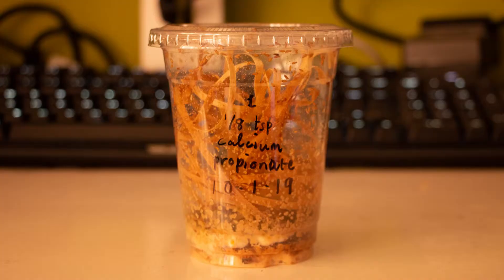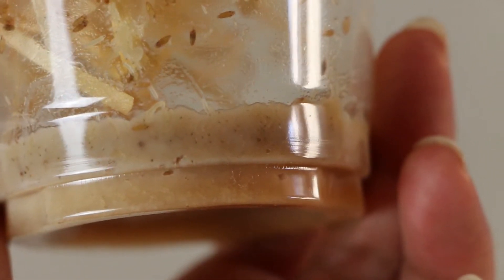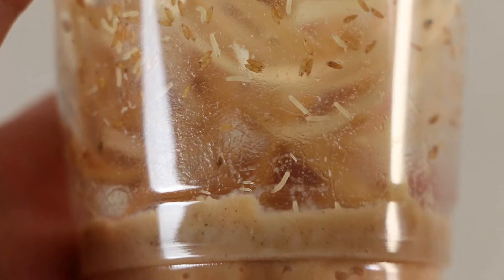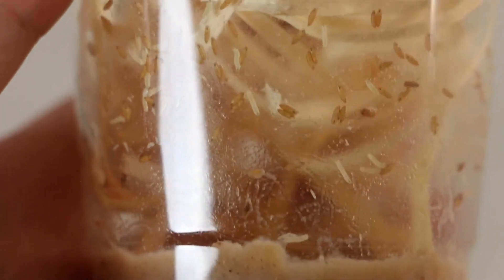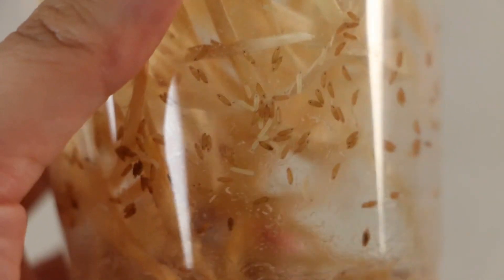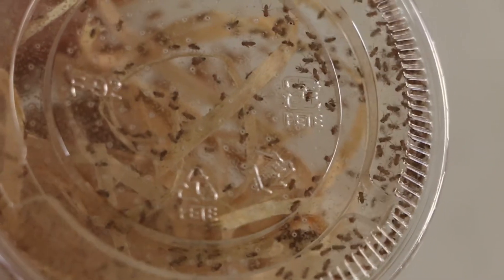High temperatures can harm the flies and larvae and in some rare occurrences, revert future generations back to their winged flying forms. Over the course of about two weeks, you will notice changes in your culture. During the first week, adults lay hundreds of eggs that are invisible to the naked eye. In a few days, tiny larvae will hatch out and live in the media at the bottom — they will eat and grow rapidly. By the end of the week, you will be able to see larvae of different sizes in the media and some of them will be starting to venture out and onto the sides of the cup. By this point, the old adult flies will most likely have passed away from old age. But new flies are on the way. Larger larvae climb up the sides of the container and become pupae — they kind of look like mini brown rice. For a few days these pupae will become darker until a fully formed adult fly has emerged. When this starts to happen, it's time to start a new culture and continue the cycle again.